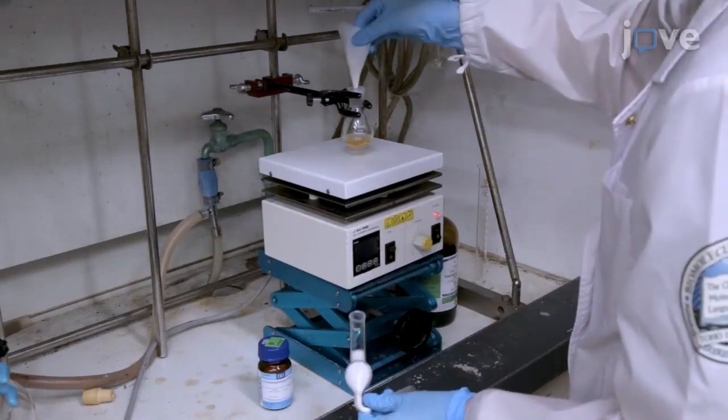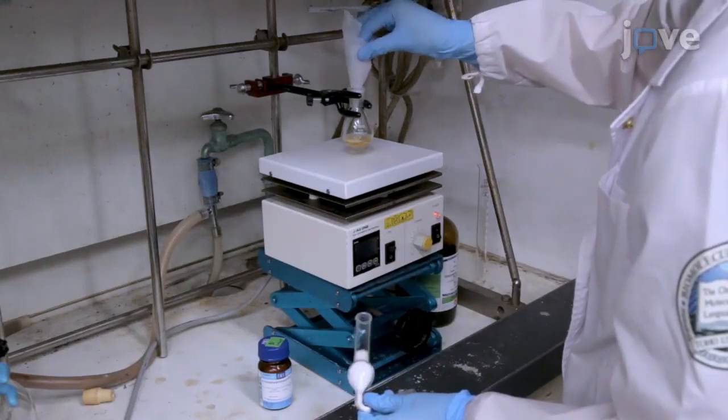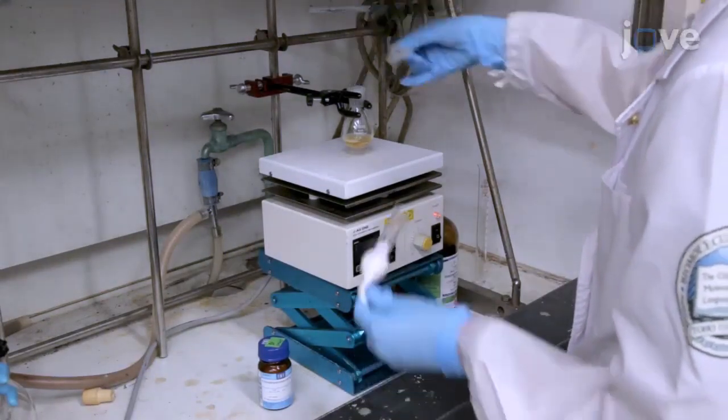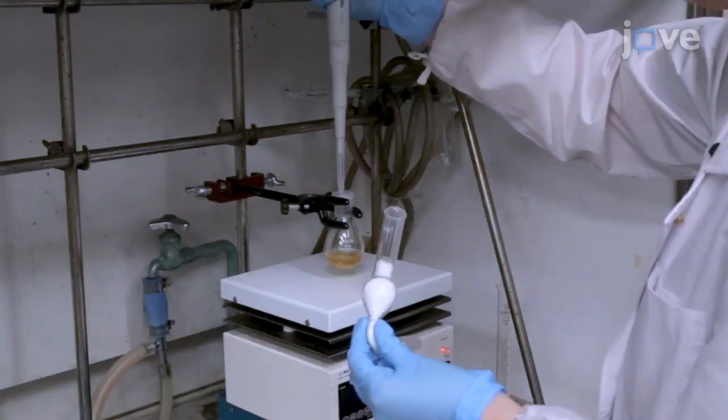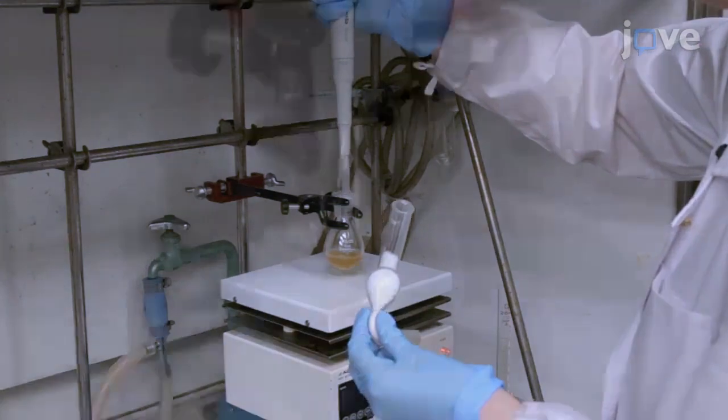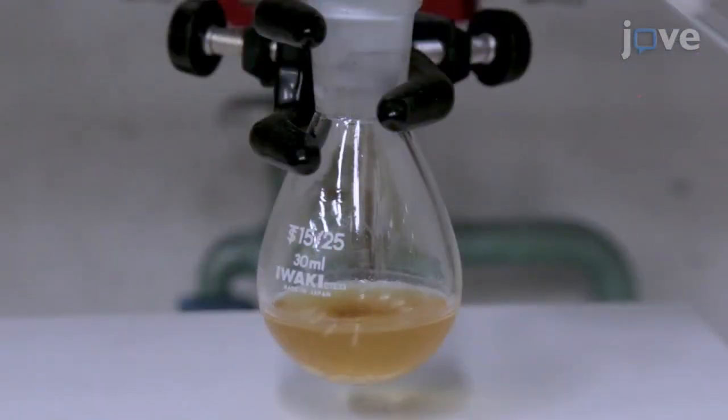At the end of the incubation, add 342.8 mg of 4-dimethylaminopyridine and 552 uL of tert-butyl-6-aminohexyl-carbamate and stir the solution at ambient temperature for an additional 3 hours.